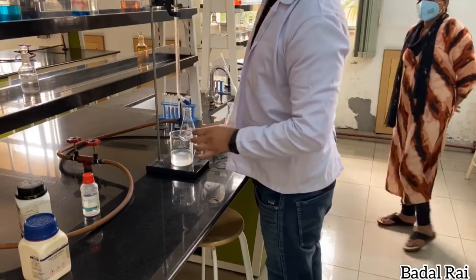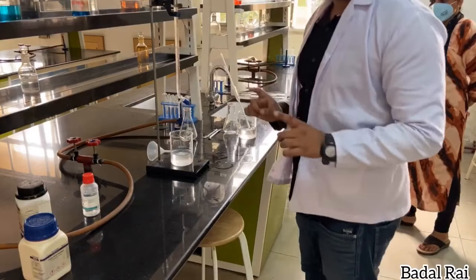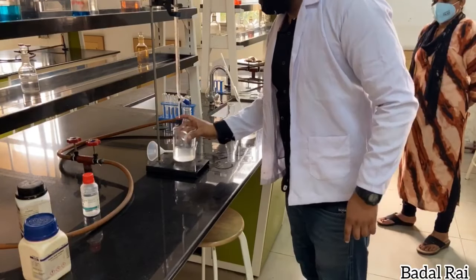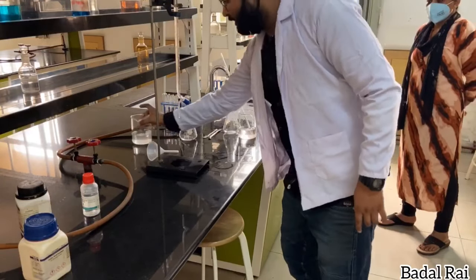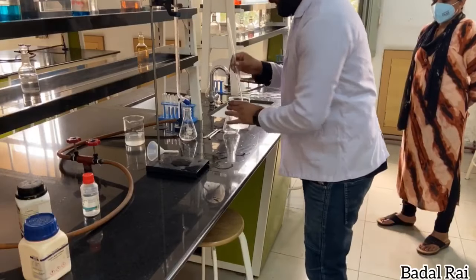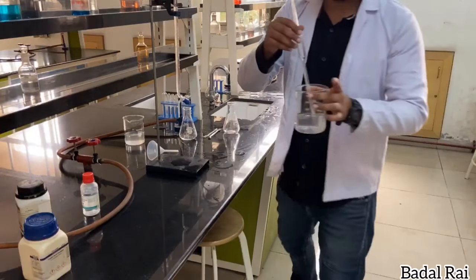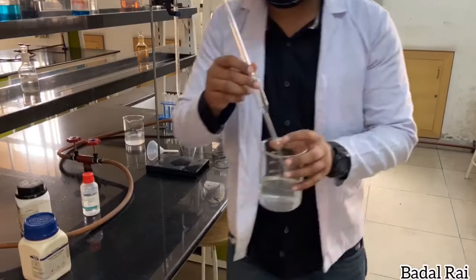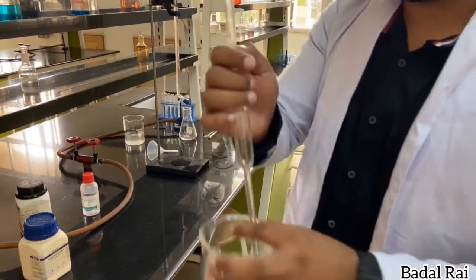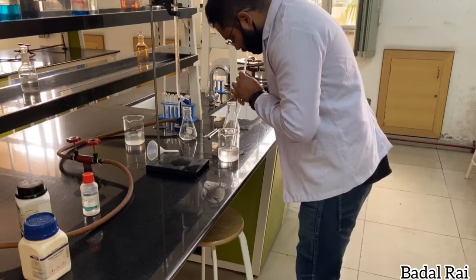After filling, we remove the funnel. Now this is sodium hydroxide — we have to pipette out 20 ml of sodium hydroxide. We are going to suck it up to the mark.